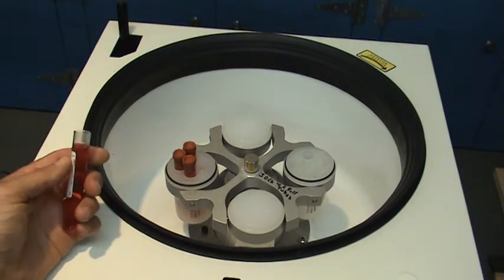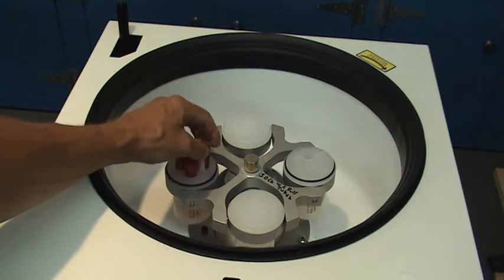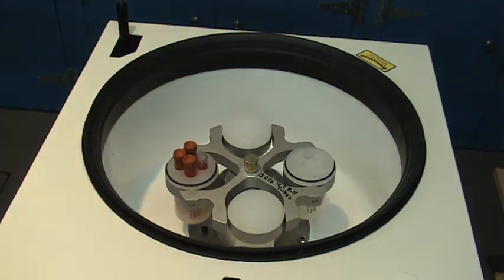We extend now the technology really to a point of craziness by installing a 4th full 10 ml, 20 gram tube in the rotor, and once again you'll see that once the center of mass is achieved, the operation is totally smooth.